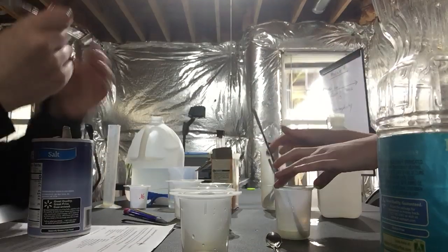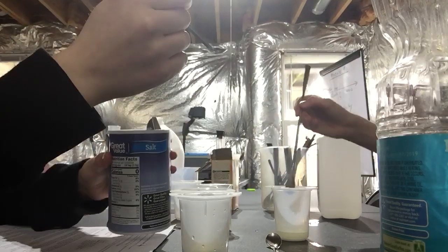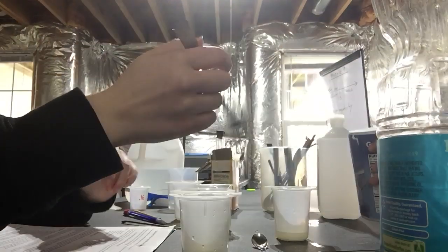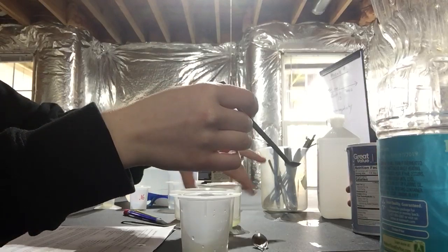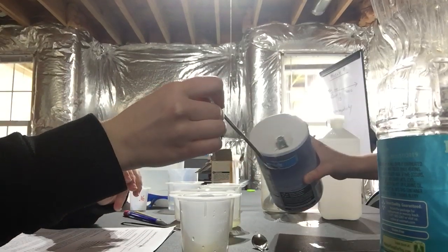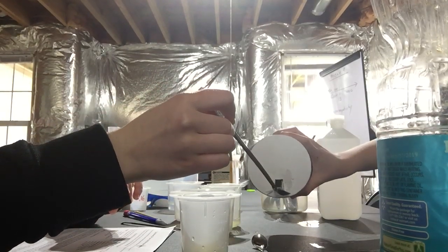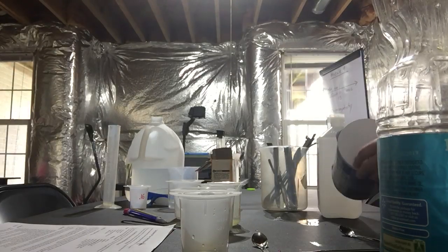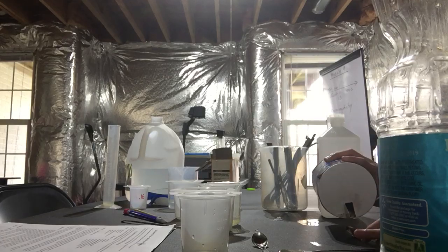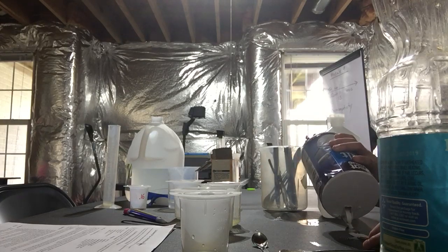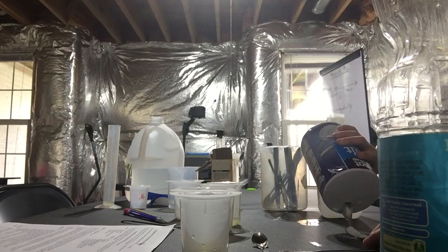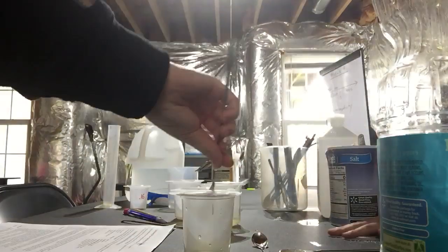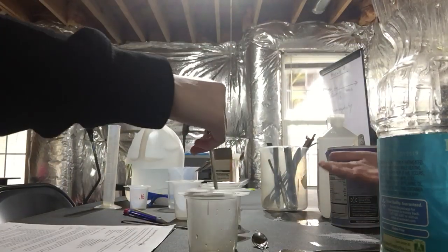No. Do your salt. It's going to tip over. Hold on. Salt. Do this. Here. Can I have it? Oops. Okay, now stir.